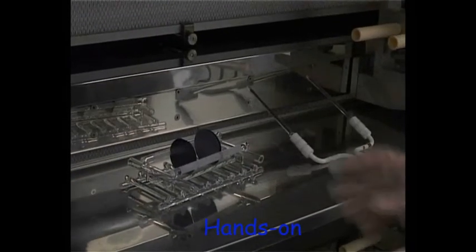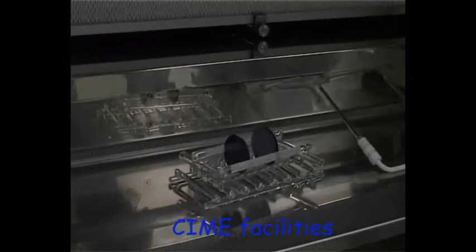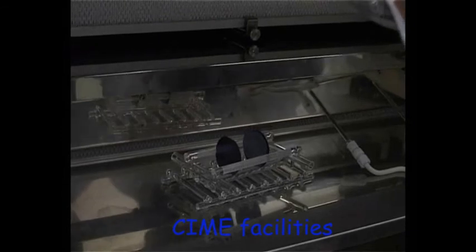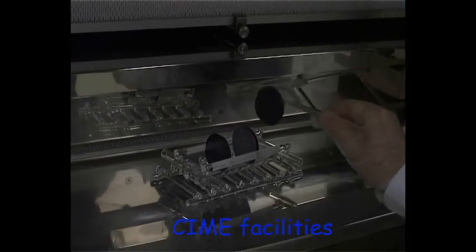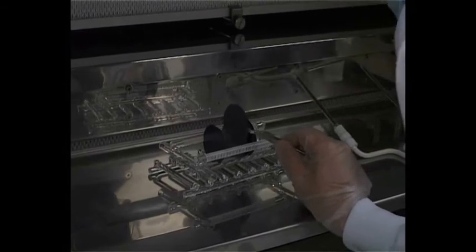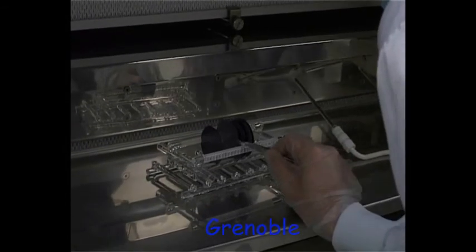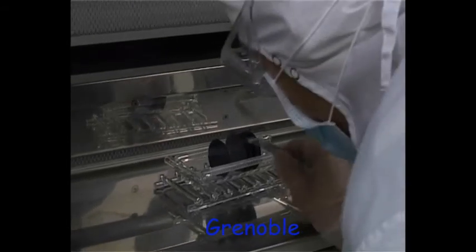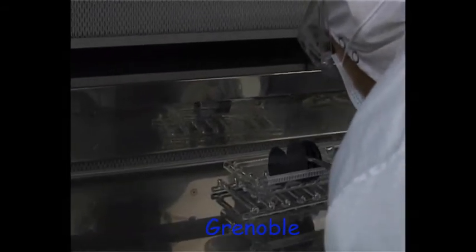Okay? Did you put the polished surface? Yes, I did. You go ahead. Okay, so one in between. Insert it as well. Okay? This is not in. Is it?